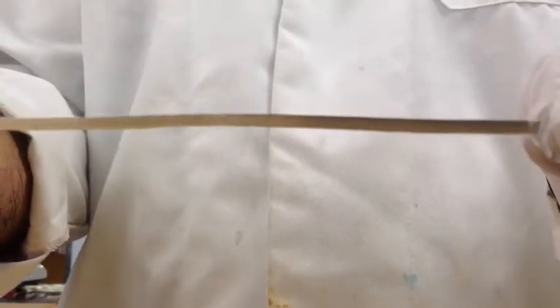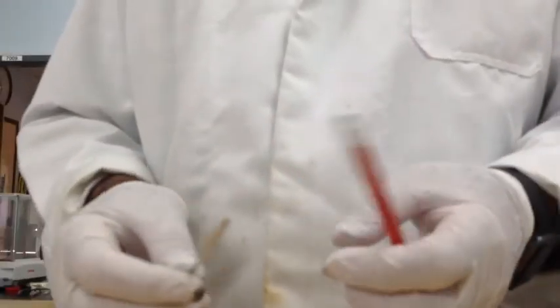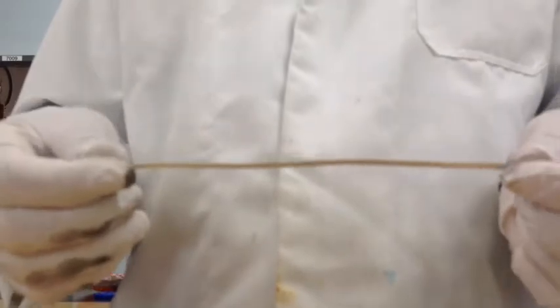This is magnesium after it's been cleaned up using the steel wool. I don't know if you can actually see it. It's still got black blemishes on there. It'll be impossible to get rid of those unless you keep rubbing it over and over again. Okay, the next thing is to find a way of putting this strip into the crucible.